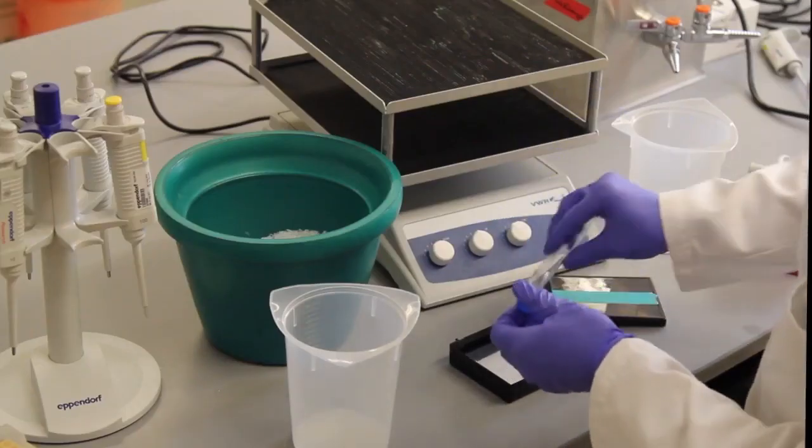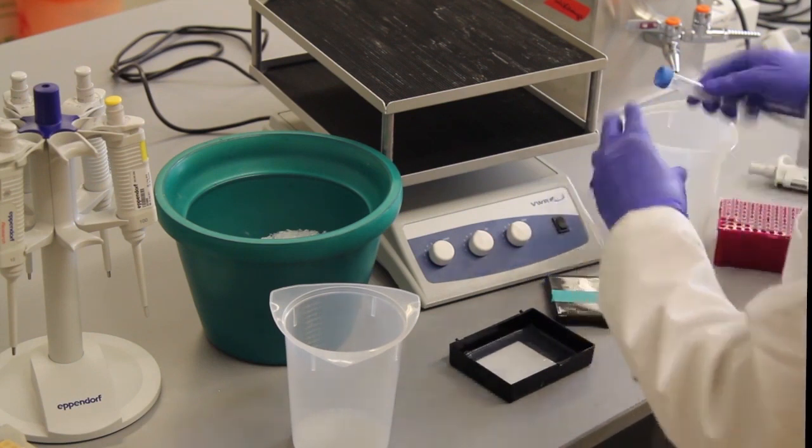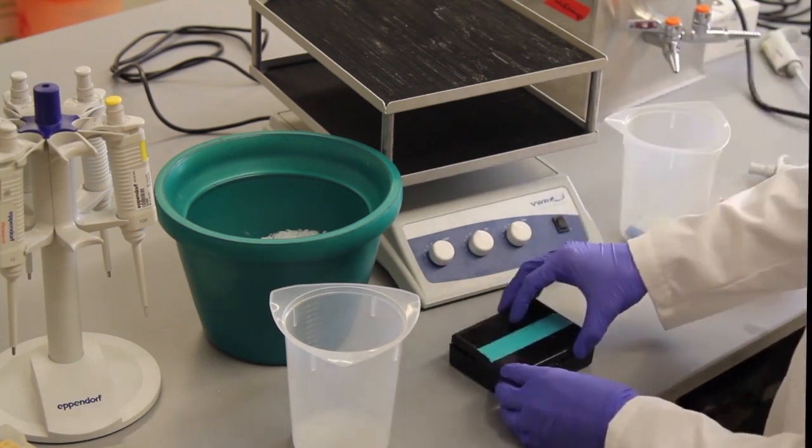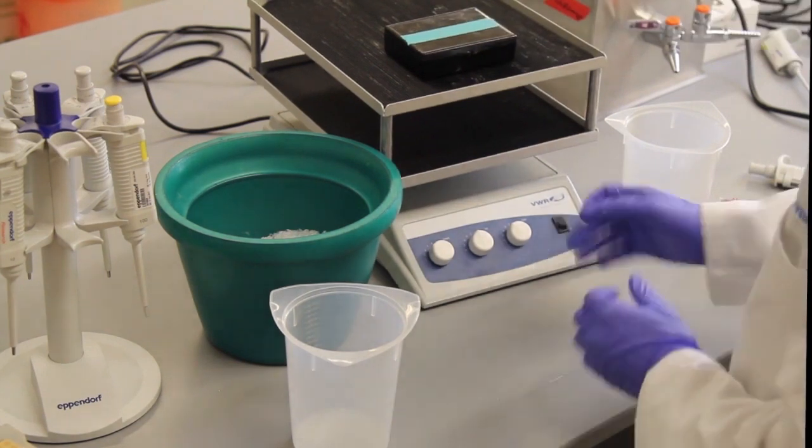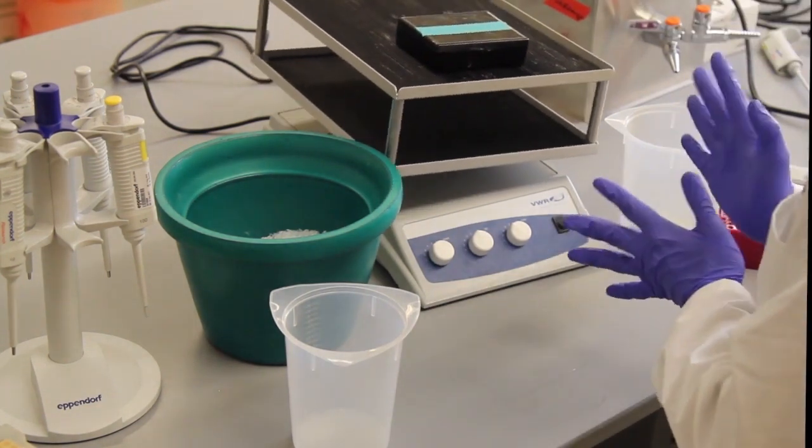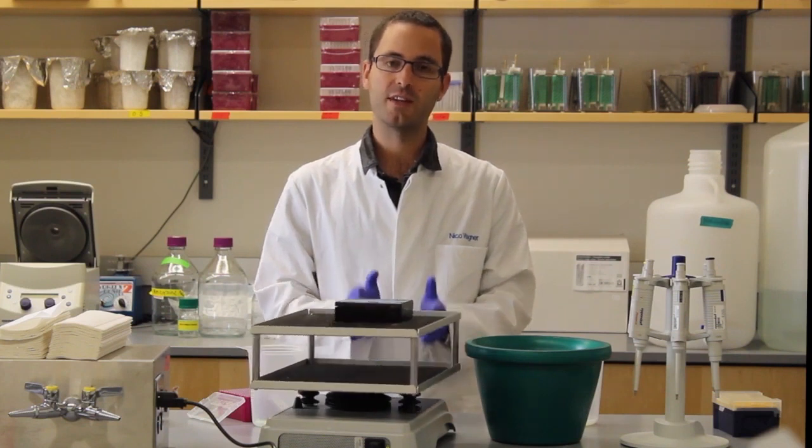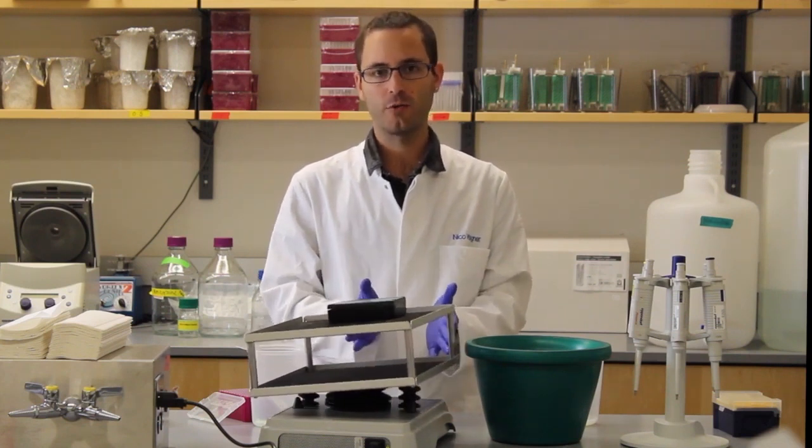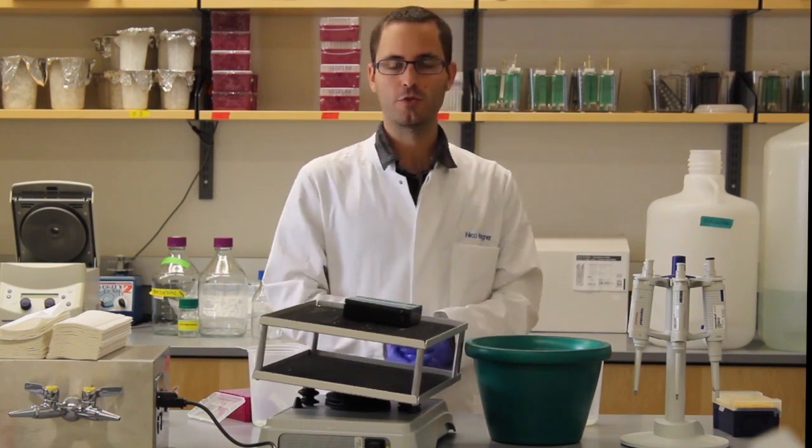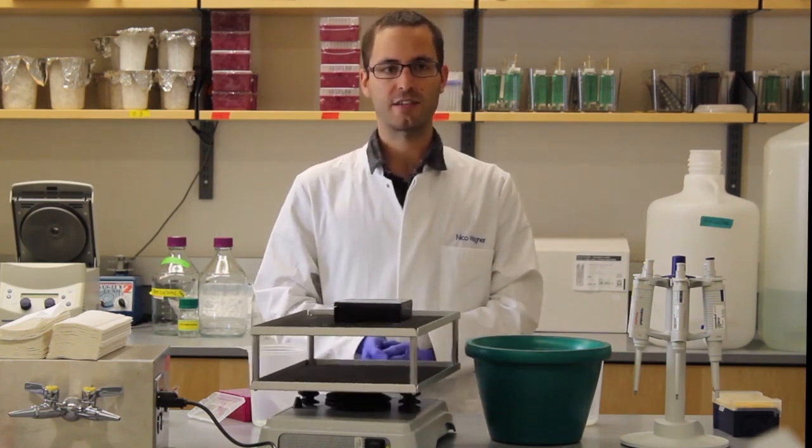Quickly invert it to make sure it's mixed. Add it on top of the membrane. And start rocking it again. This primary antibody incubation step can be done in one of two ways. It can either be left at room temperature for about one hour, or it can be placed into a cold room and left overnight to come back to the next morning.